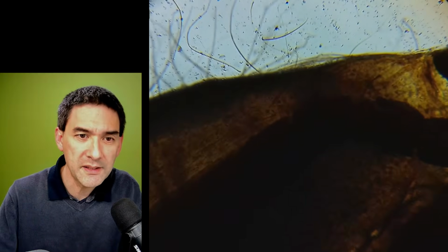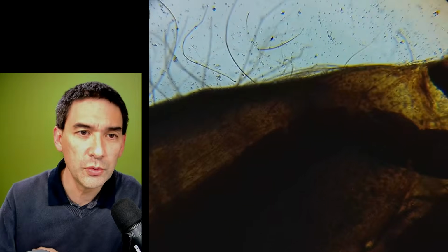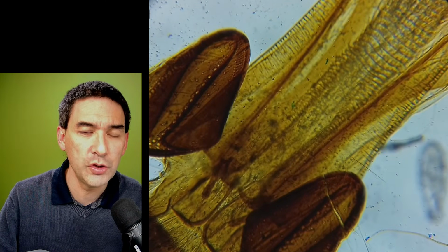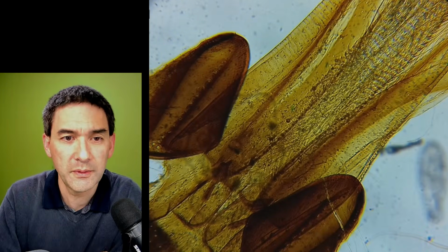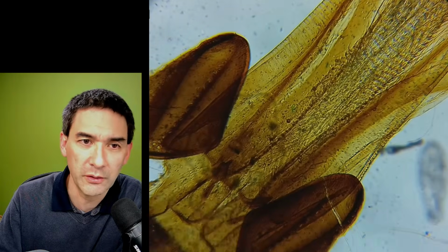And this is now basically the mouth parts of a honeybee. And usually those insects are difficult, because as you can see, they have very dark areas and very bright areas, like over here. So this is a dynamic range issue. But I would still say that honestly, microscopy's gone a long way.